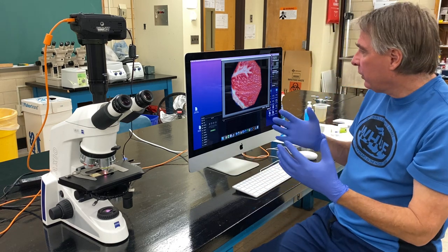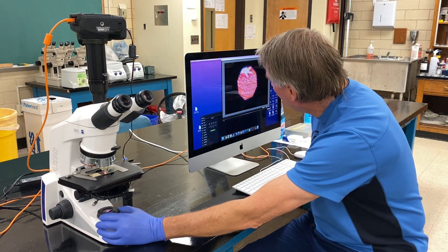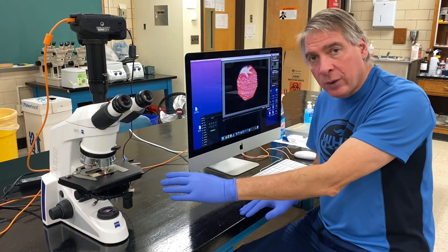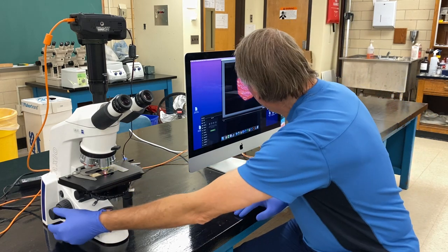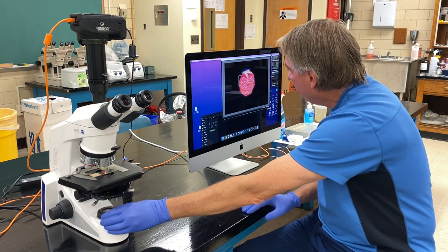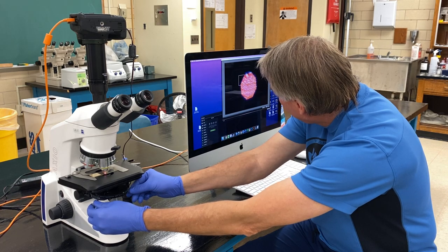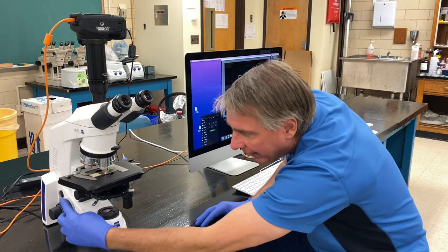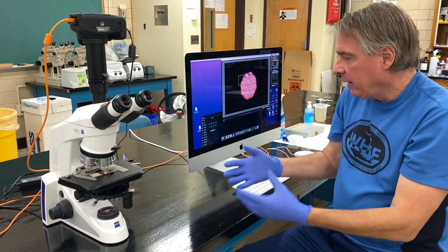Set up Köhler illumination by dialing down the field diaphragm to a small size. To carry out Köhler illumination you have to have a sample on the stage because the sample needs to be in focus to properly set it up. I've put a prepared slide on the microscope, focused it with the focus knobs, turned down the field diaphragm so I can see all of the edges, then centered the light and made the edges sharp using the condenser lens focusing knob. Now the system is set up in Köhler illumination.